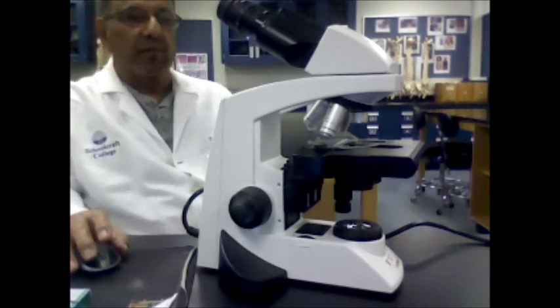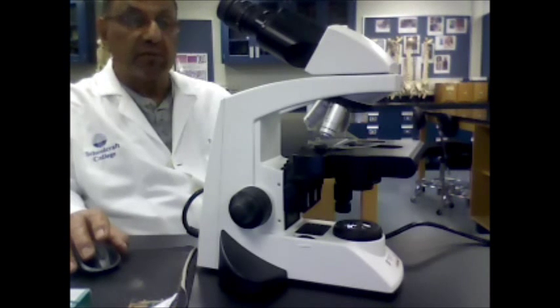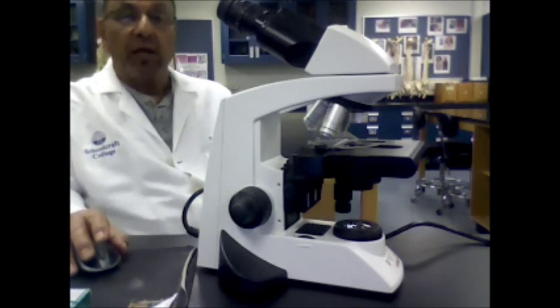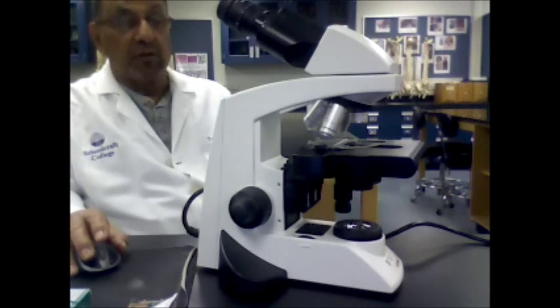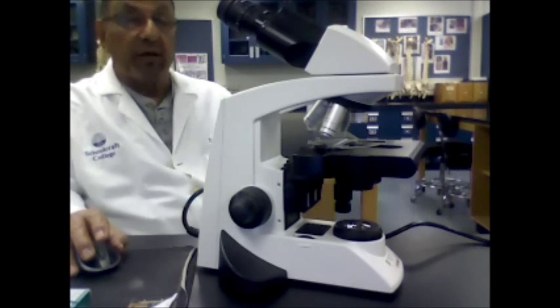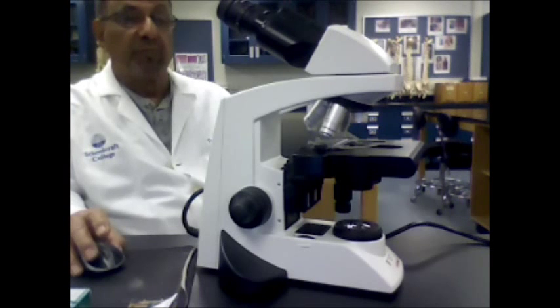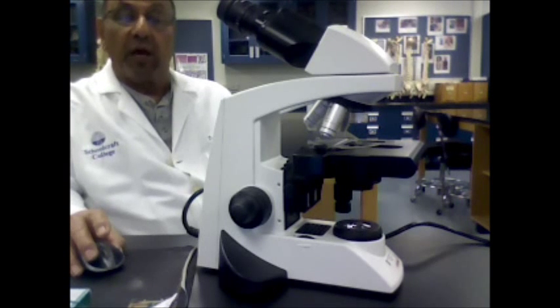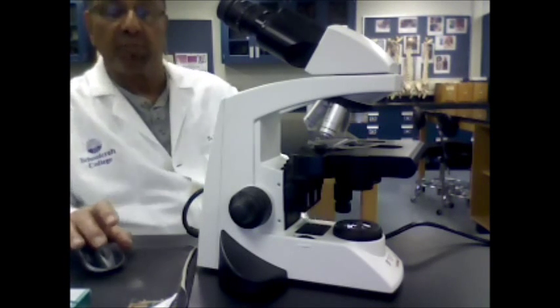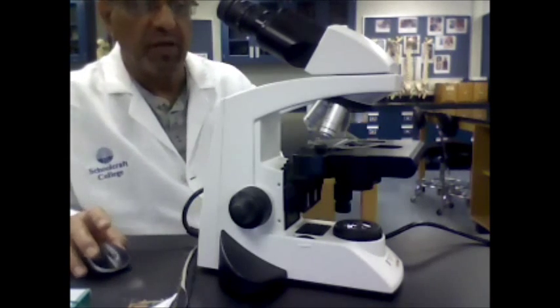Hello, this is the compound microscope that we're going to use in the lab. We're going to learn the proper way of using the microscope and we're also going to learn the function of the different parts of the microscope.